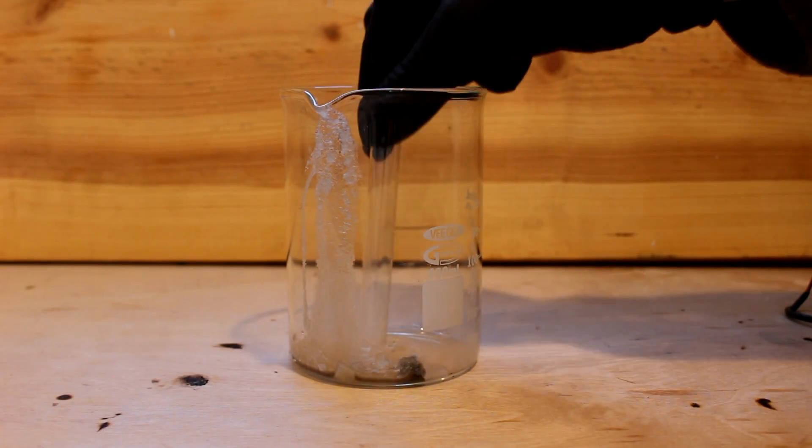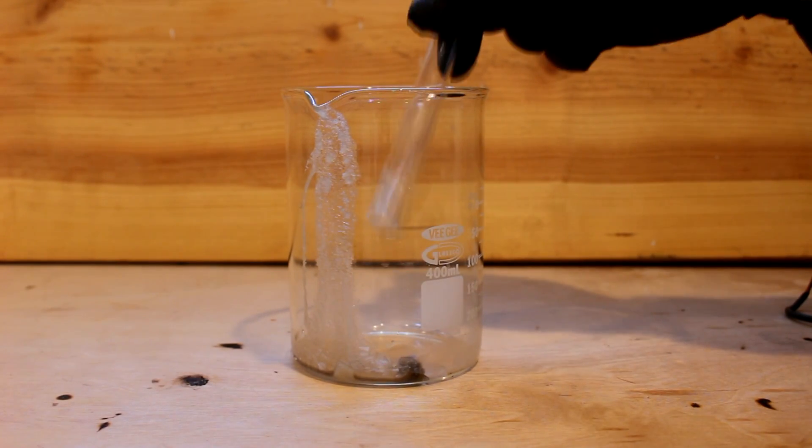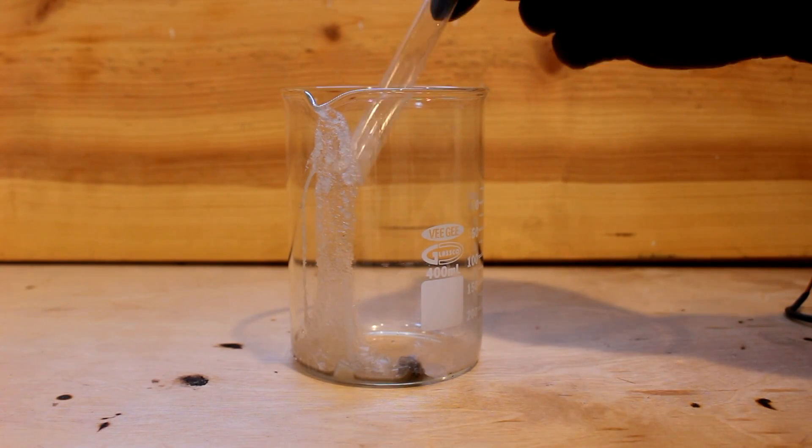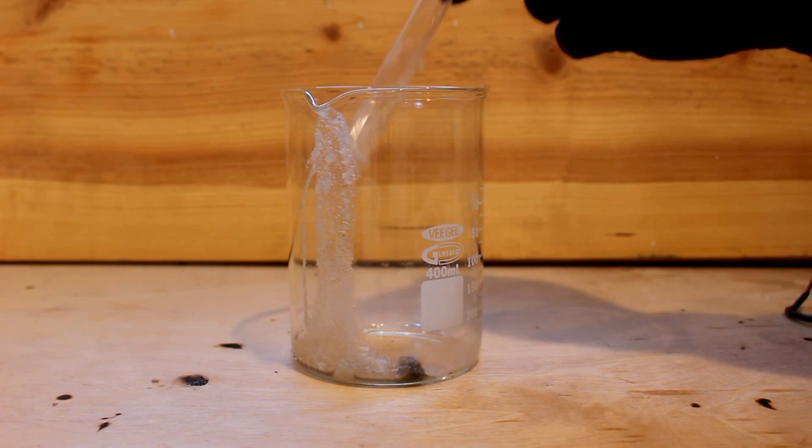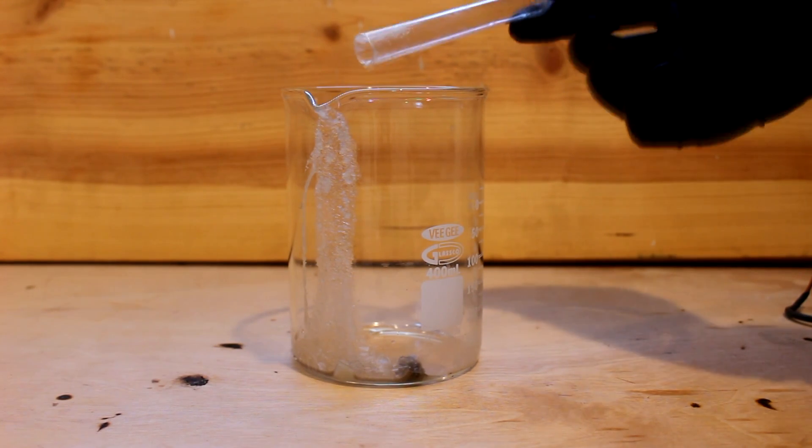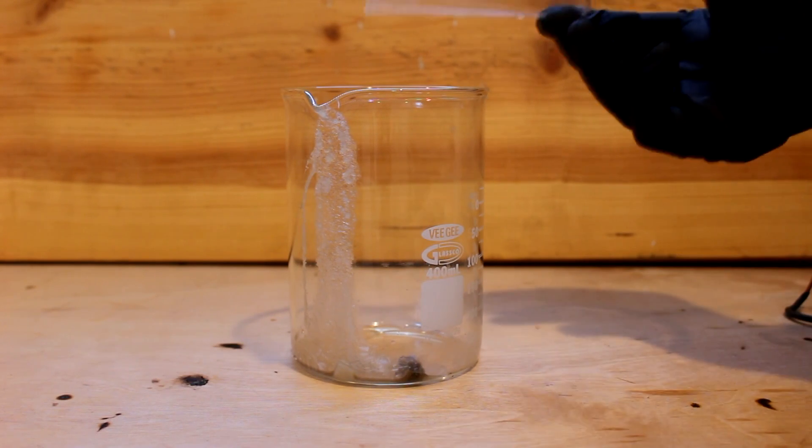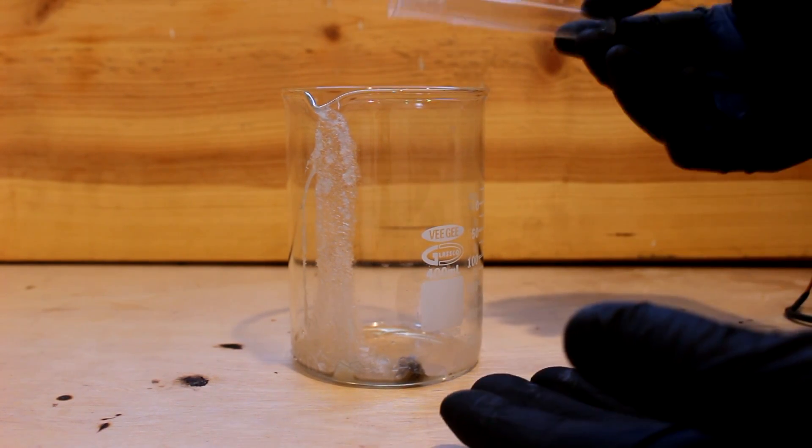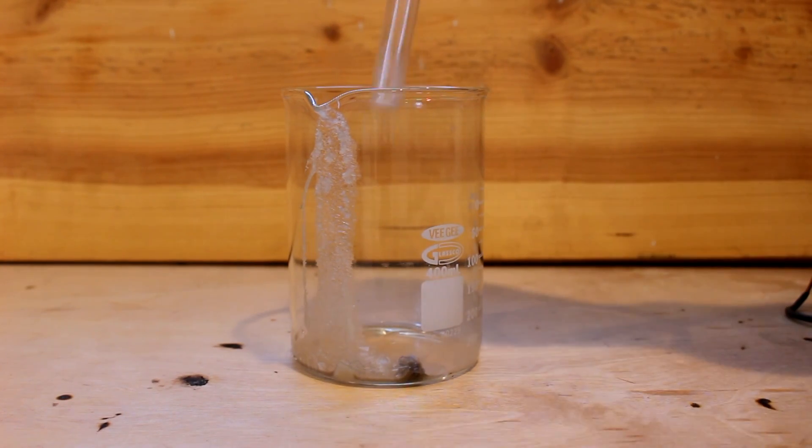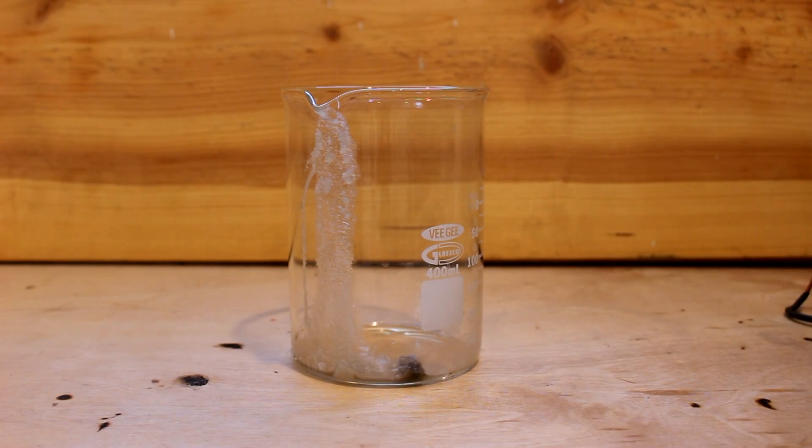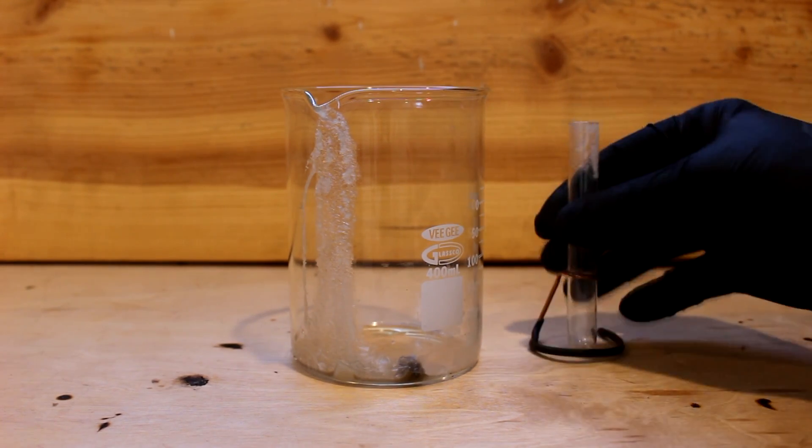So there you have it. Possibly the heaviest aqueous solution in the world. I think you could go a little bit heavier if you maybe added a couple more ions, took advantage of the multiple ion effect a little bit better or used heavy water instead of normal water. But I can't imagine going more than a couple of percent heavier than this. This is possibly, you know, this is approaching the limit to what you can achieve with the aqueous solutions.